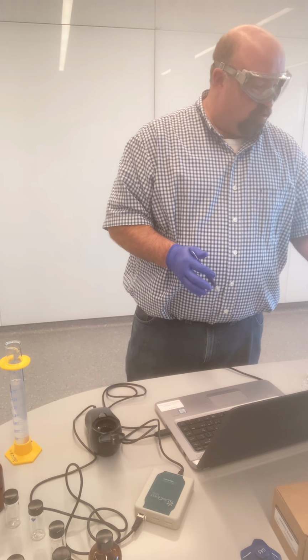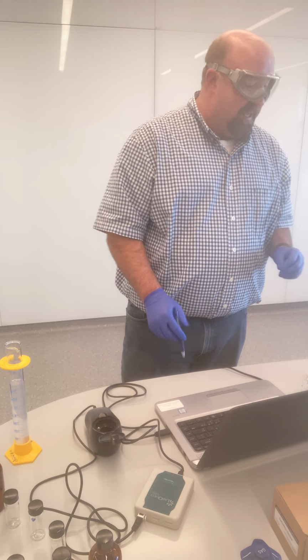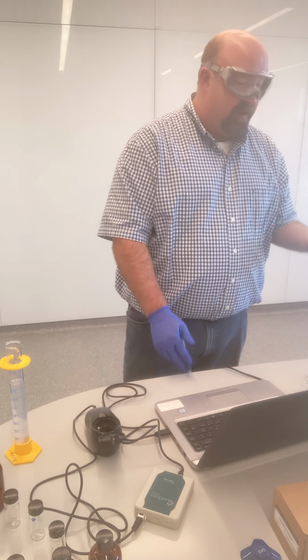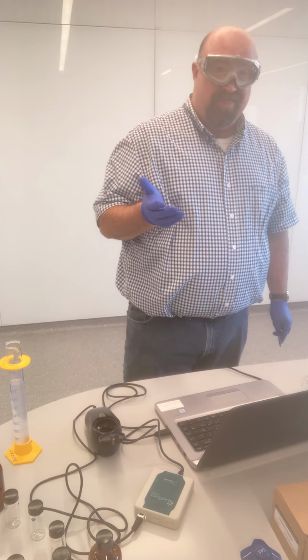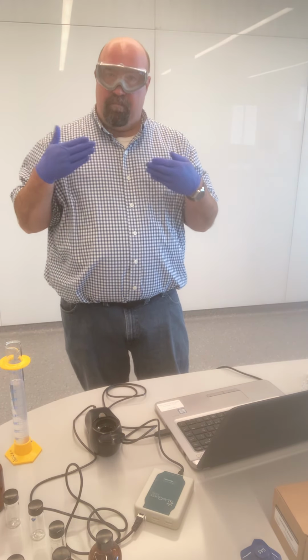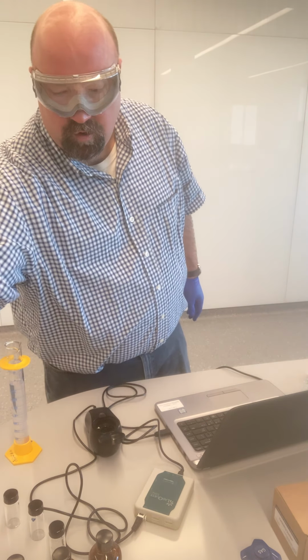Now, this also shows you why it's necessary to do this. Before we diluted, we were getting NTU values or turbidity values up around 500 for this sample. The actual value, when we diluted and got to within our calibration range, was more like around 330 or so. So this shows us that absolutely, this meter is not accurate outside of that calibration zone. And that's why this illustrates perfectly to us why it's necessary to do what we just did.